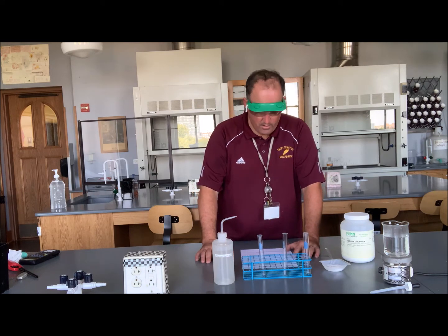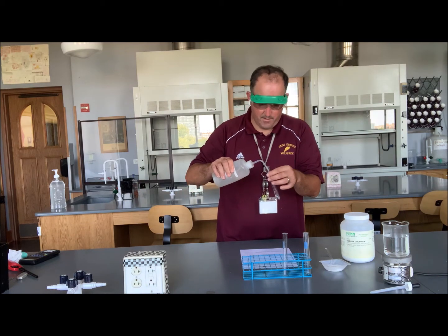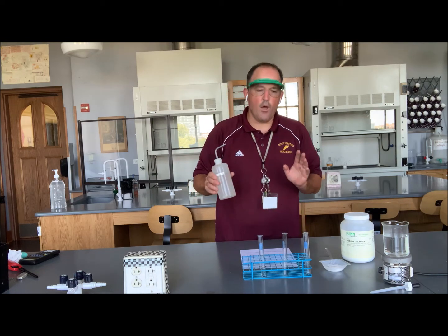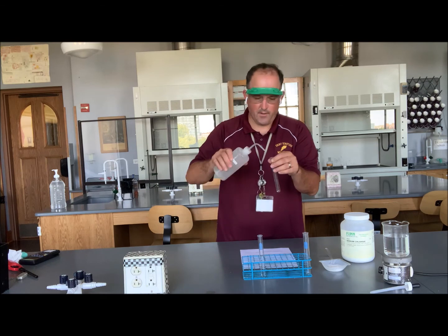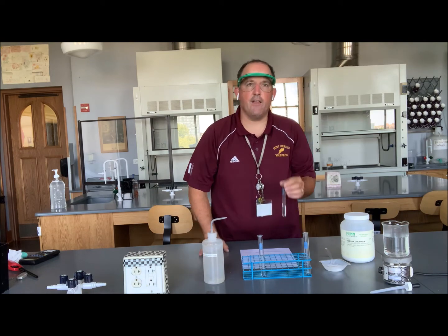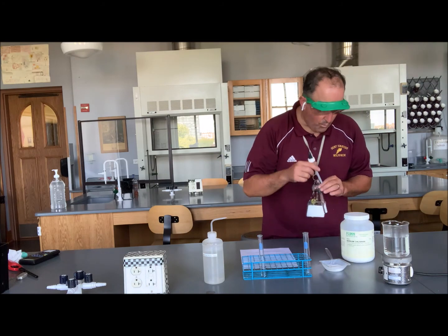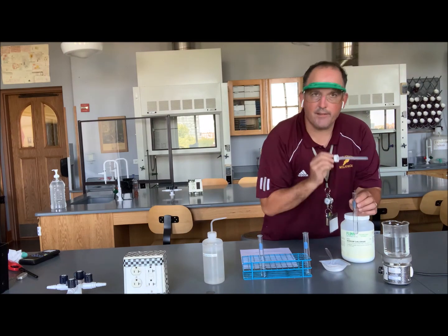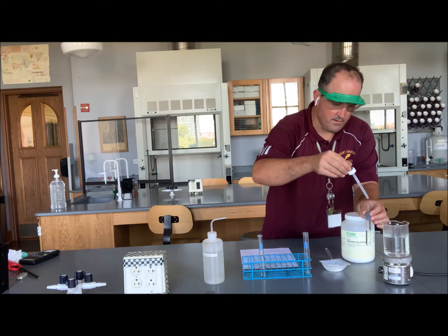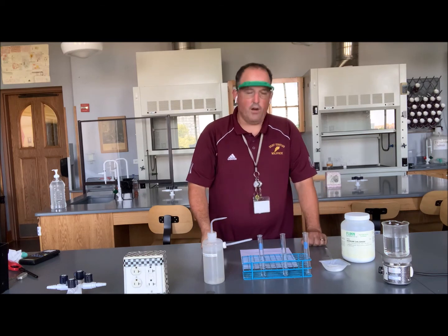At the low temperature test tube, let's make this test tube number 1. That's room temperature water. I'm going to half fill it with a deionized water bottle. With test tube number 2, I'm going to fill it a quarter full with water from the deionized water bottle. But then I've got this hot water sitting on a hot plate. It's boiling right now. Because it's crazy hot, I'm going to use a dropper to transfer it, so that I don't burn my hands, but I can still transfer the water. And that's about half full as well.